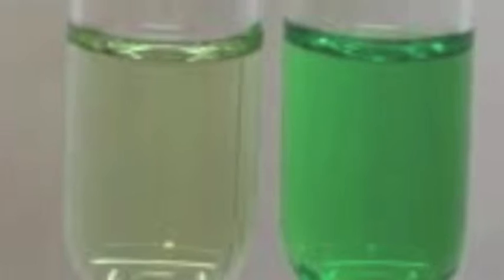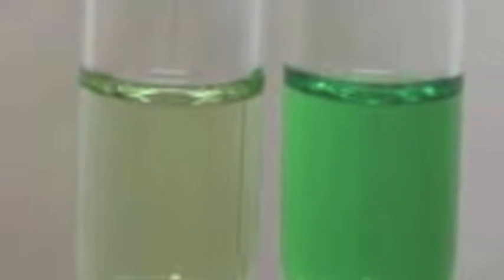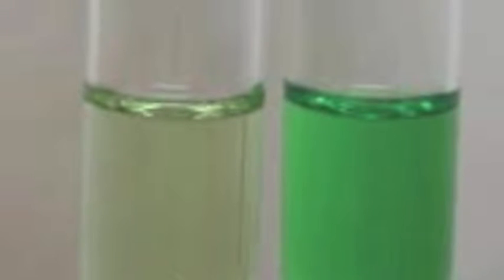This is what copper chloride looks like in its solid form. When the copper chloride is placed into the water, the ionic bonds will break. They will get weakened and dissolve. Depending on how saturated the solution is will determine the color of it.